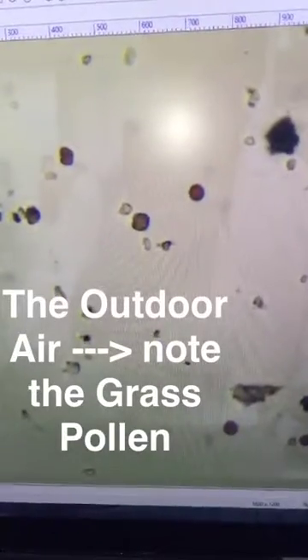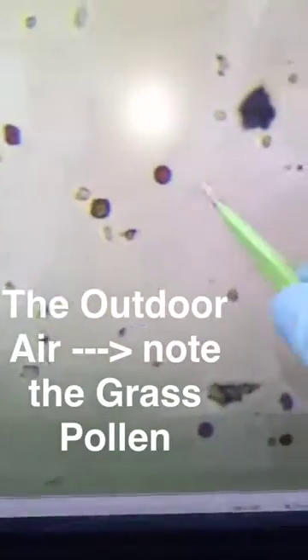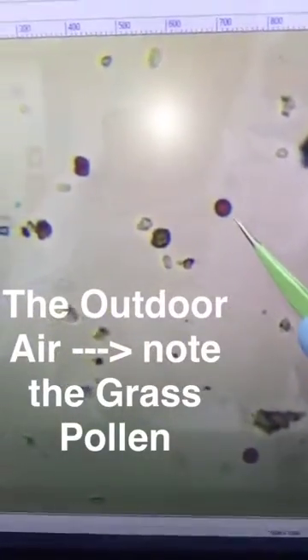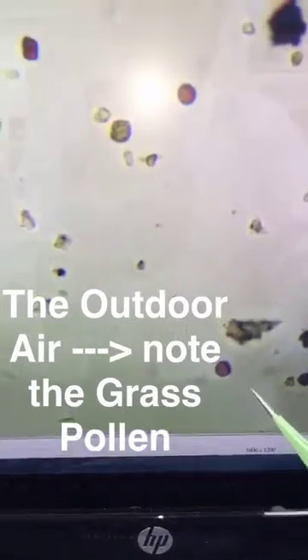This is quite exciting looking at what's in the air under the microscope, and here you can see a well-known allergen which is called Johnson Grass Smut.